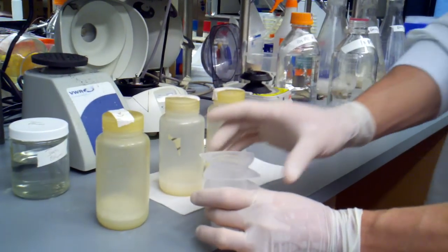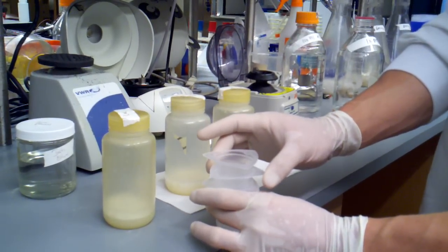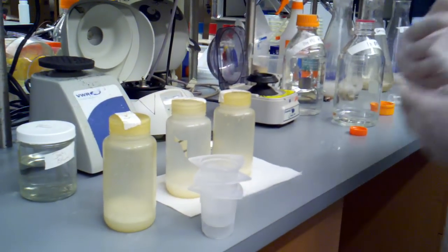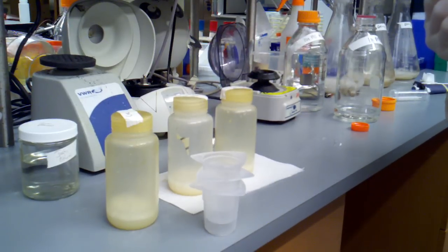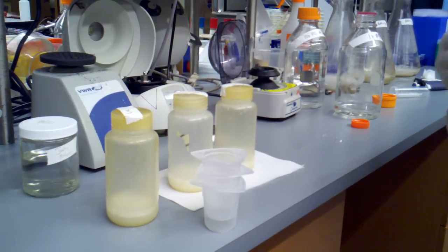And we're going to keep these on ice. The sonication produces a lot of heat, so we need to make sure everything keeps cool. Otherwise we might lose some protein. So, let's cut it there.